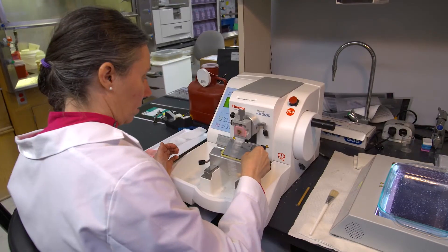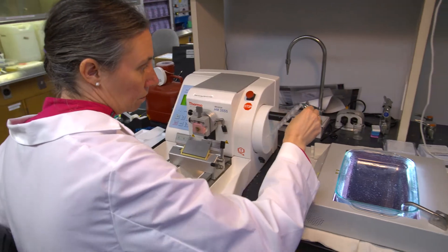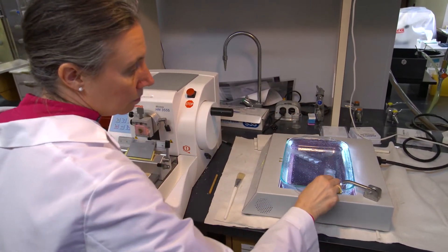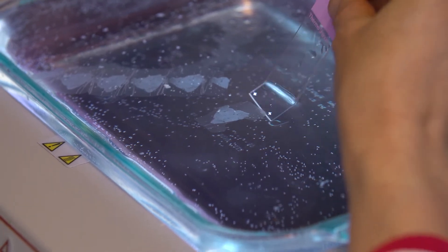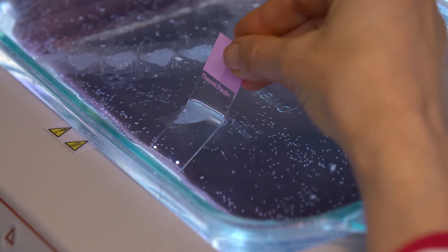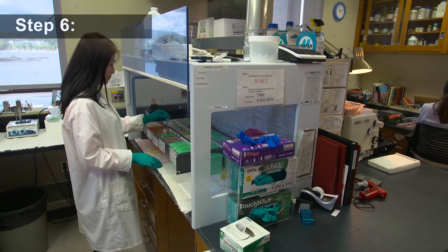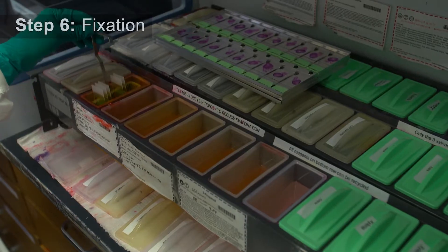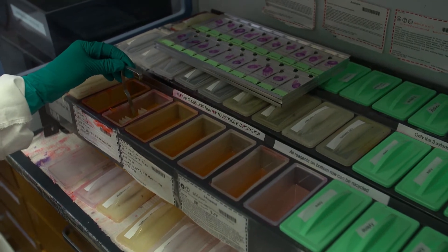The ribbons are transferred to a warm water bath, separated and picked up onto glass microscope slides. The slides are put through a series of washes, heat and drying steps to affix and stain each tissue cross-section to the slide.